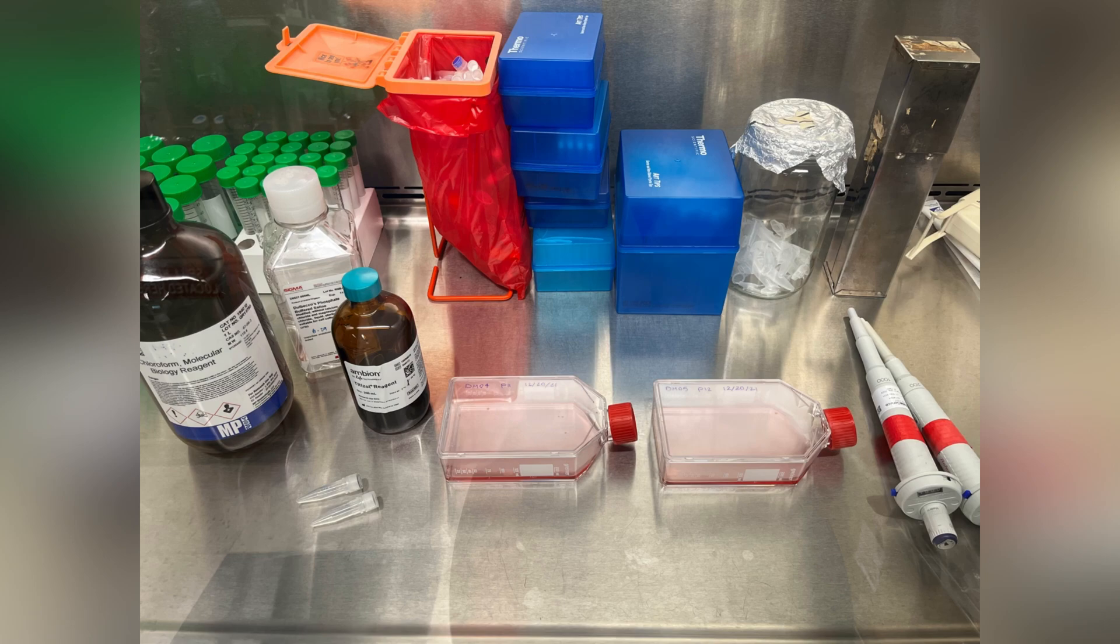Remove everything and put it in 1.5 ml tubes. Don't forget to wear gloves, goggles, and a lab coat for your own safety.